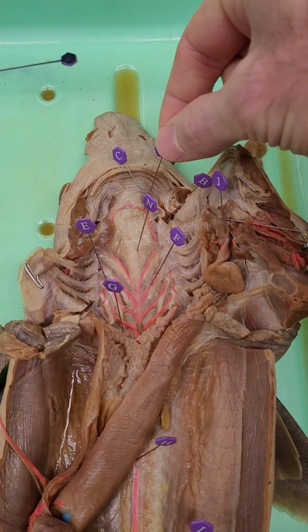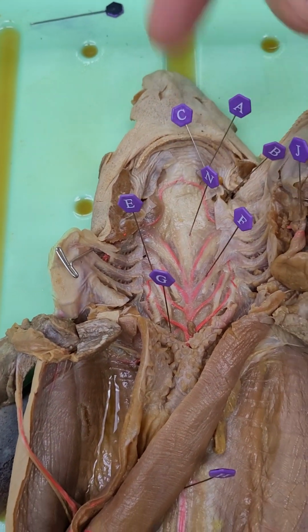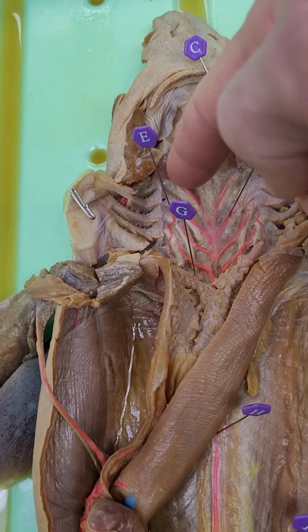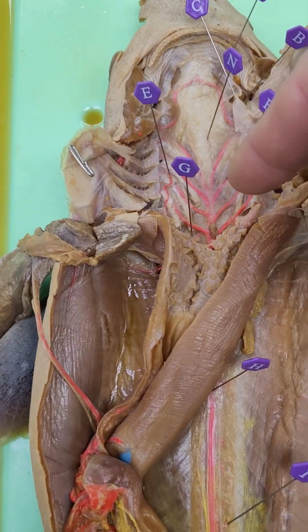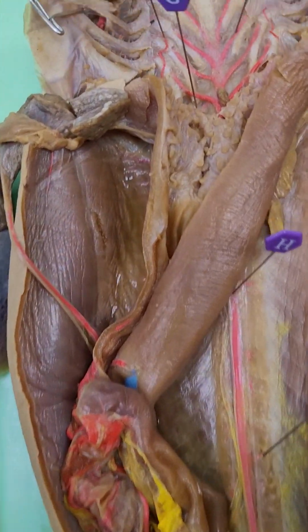We have here the internal carotids, which is these two here. That's blood primarily getting to the head, and you see it's branching off of one of these aortic efferent arteries. So the blood's come from the heart, gone through the gill, and then these efferent arteries are meeting, and they're going to pass into the dorsal aorta, which you can see coming down the body.